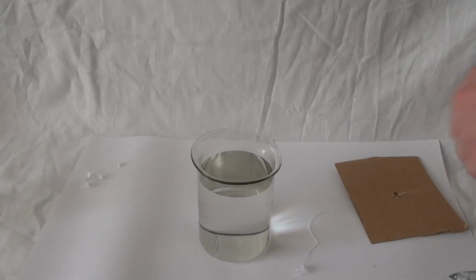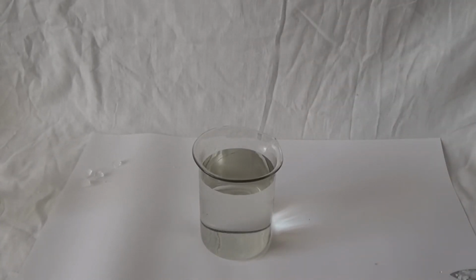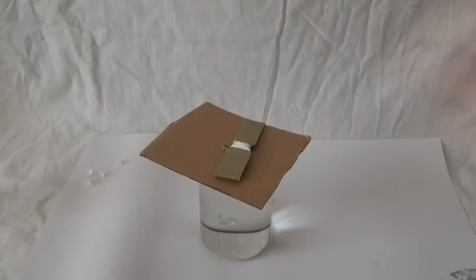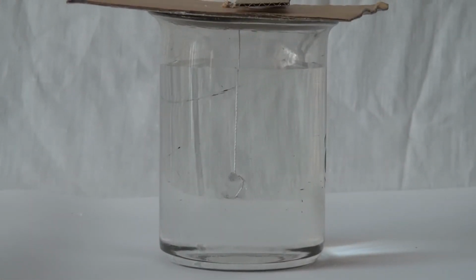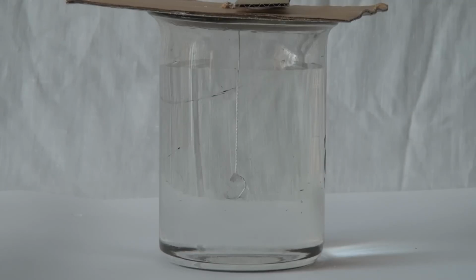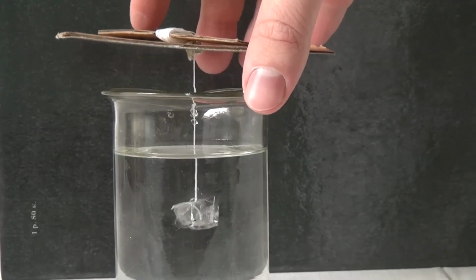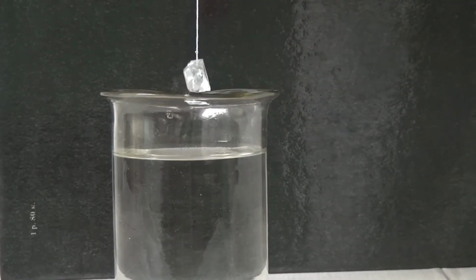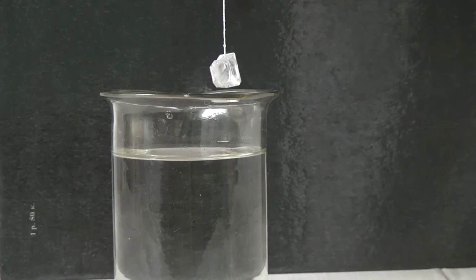However, for myself, I've decided to use a system in which the glass will be protected from dust. I think this is not necessary. At the moment, we can only wait for the crystal to grow. Over the time of growth, the crystal will become bigger and bigger. This occurs because the water from the solution will gradually evaporate, thereby increasing the concentration of the solution.